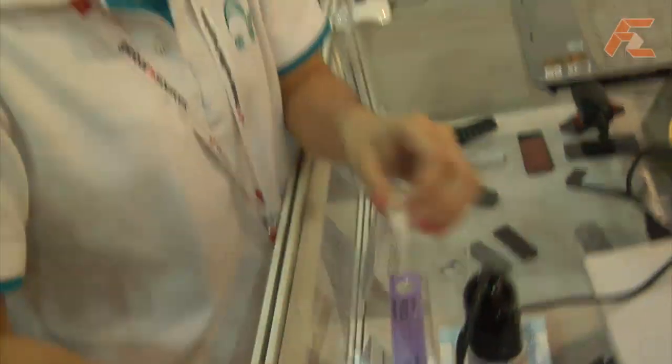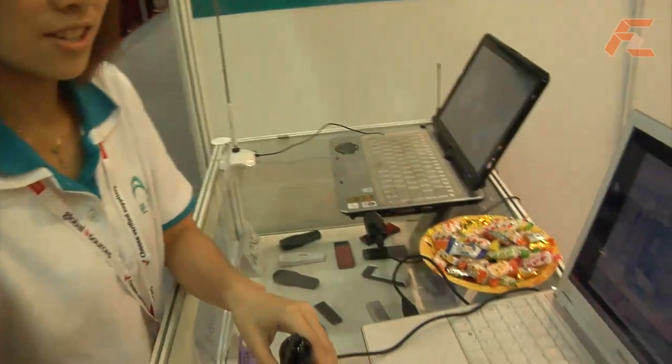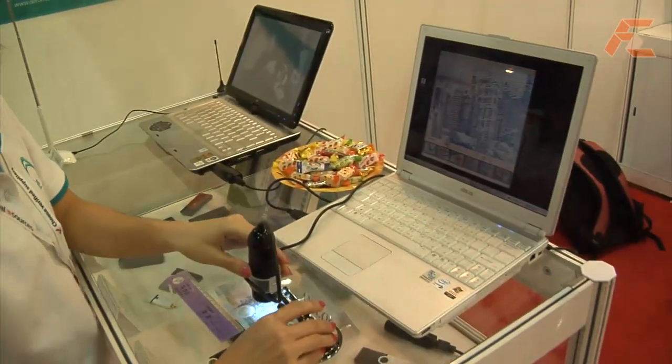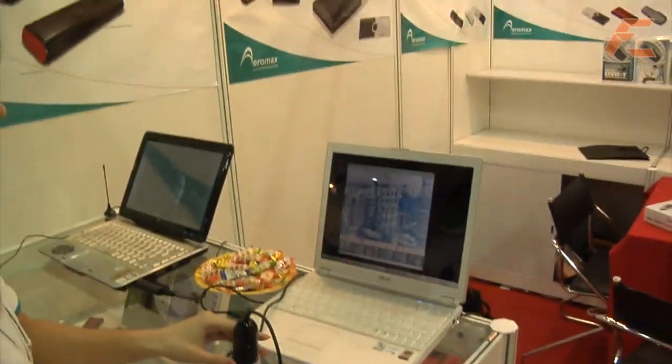Any other special things about this product? Our product has a ruler function. So you can measure on a microscopic scale.